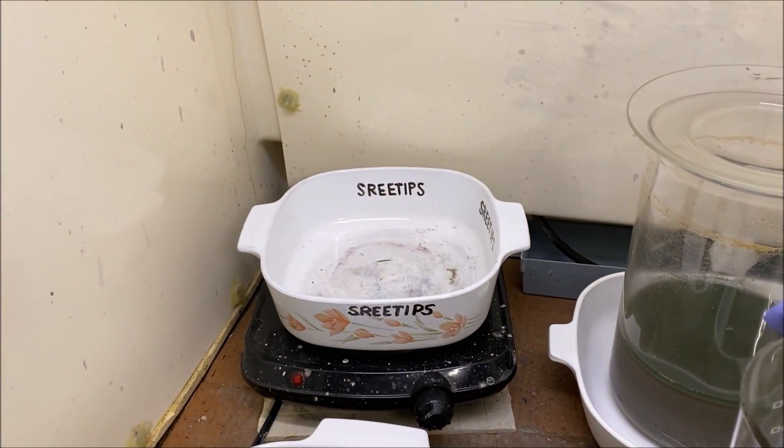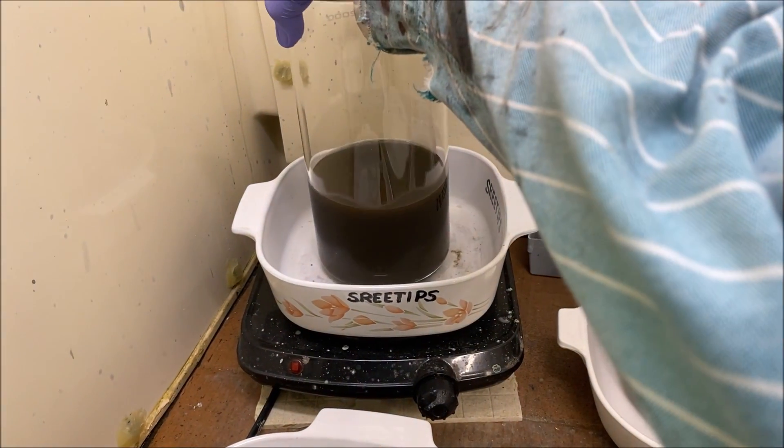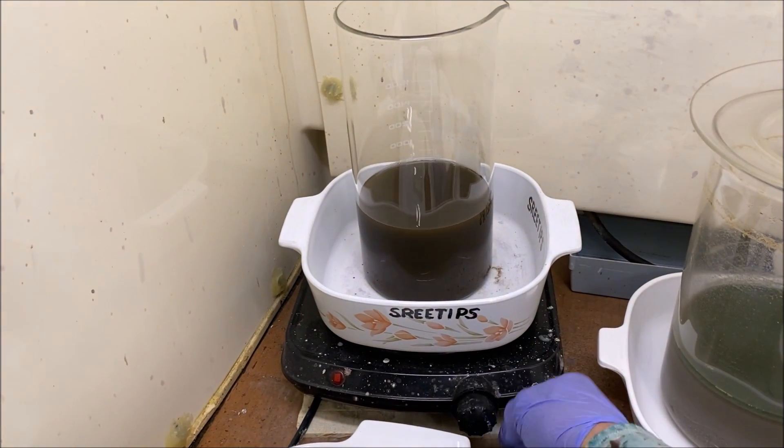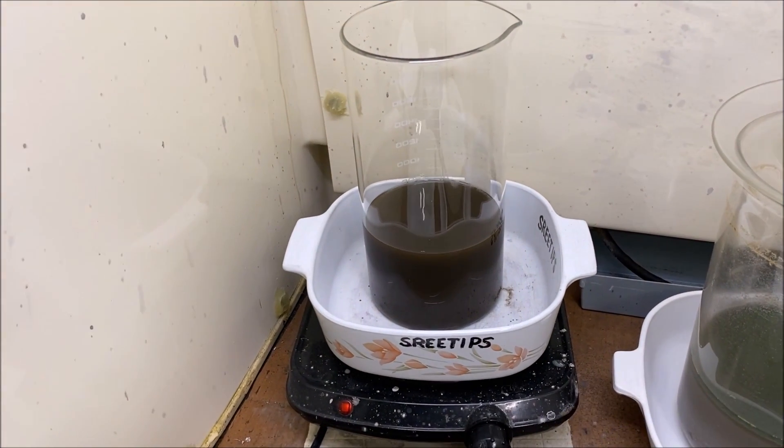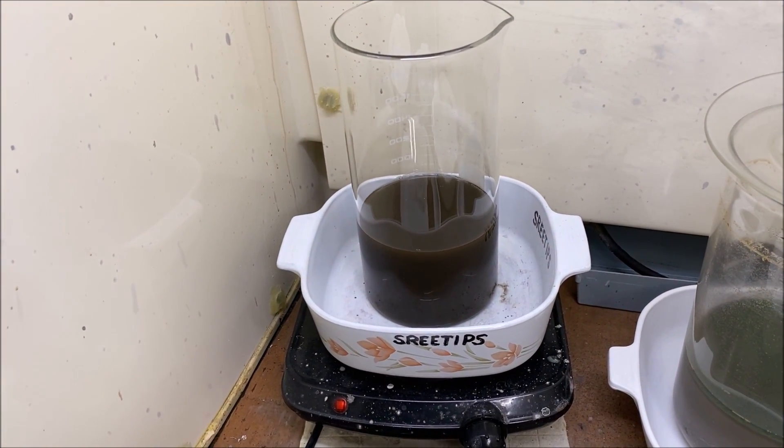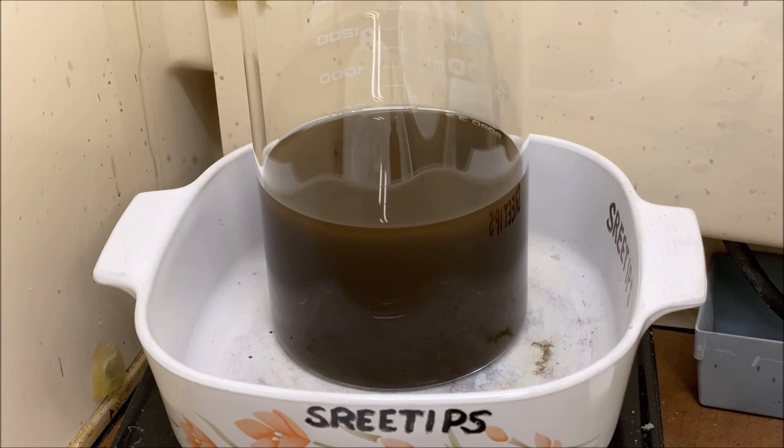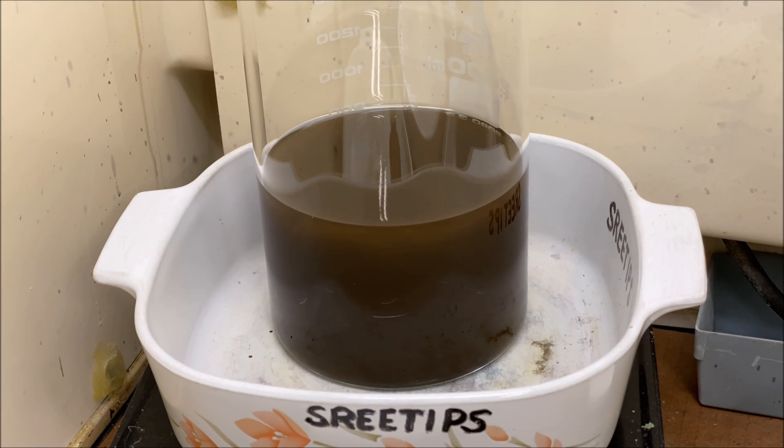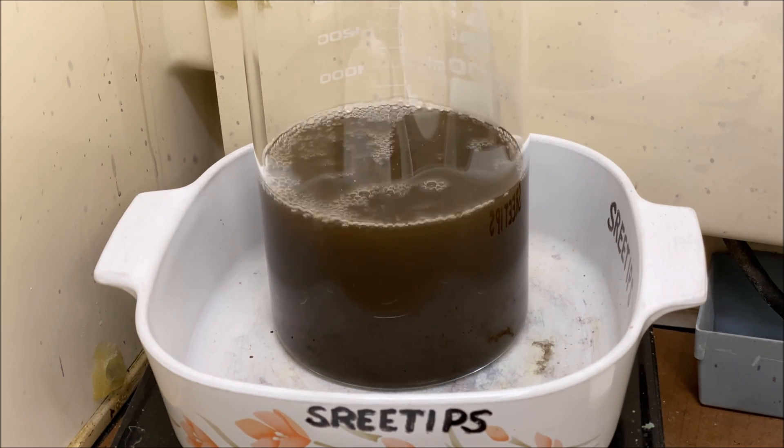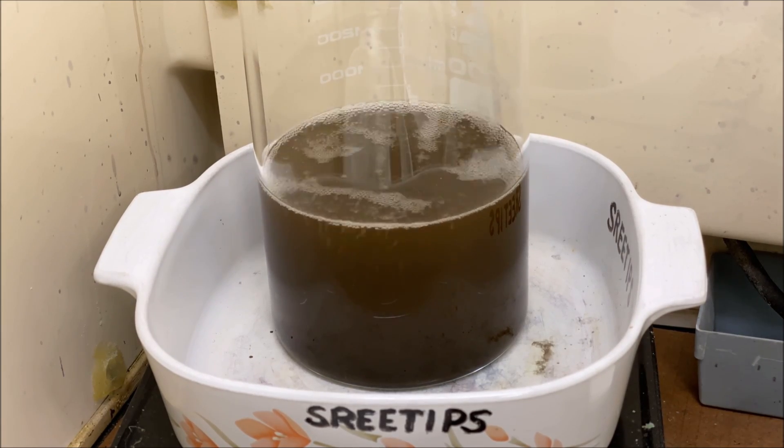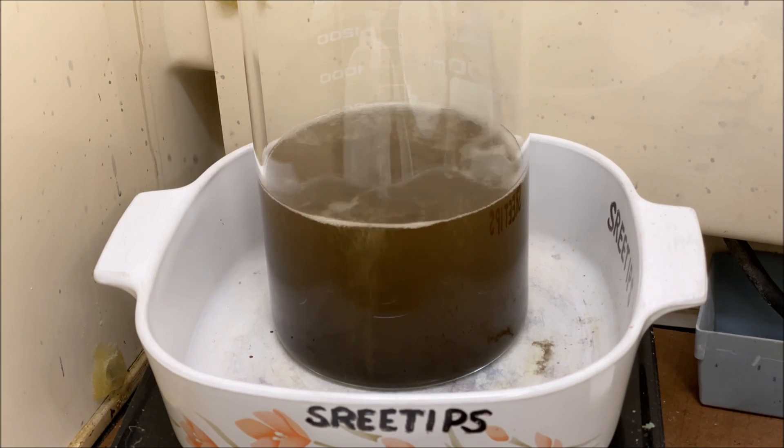I'm going to set this up on the heat and we'll try to get it to settle out quickly for us so we can recover that gold and melt it into a little button.